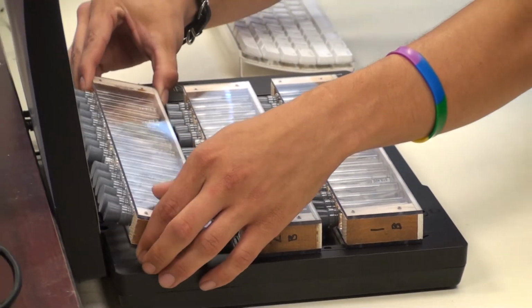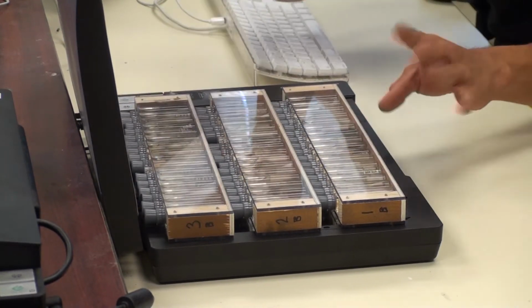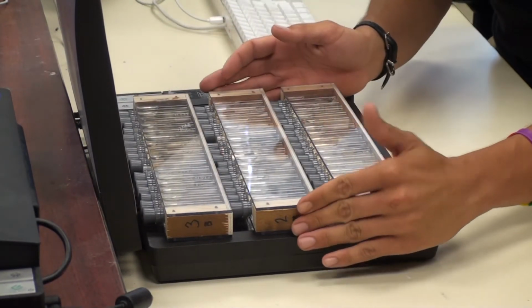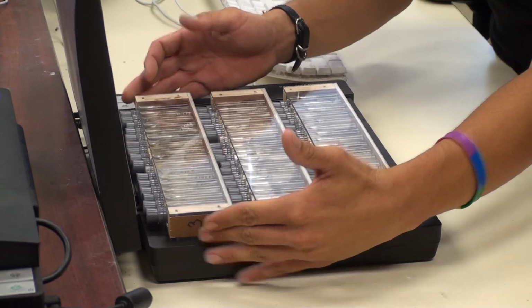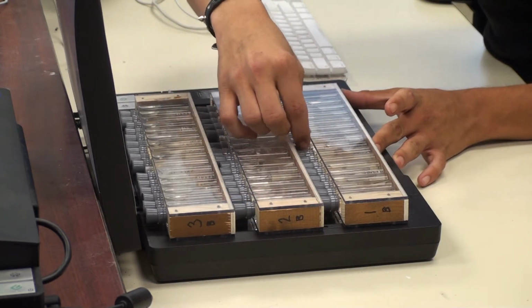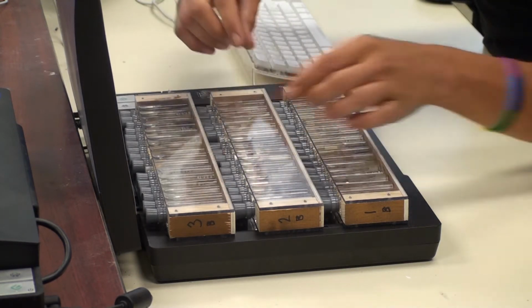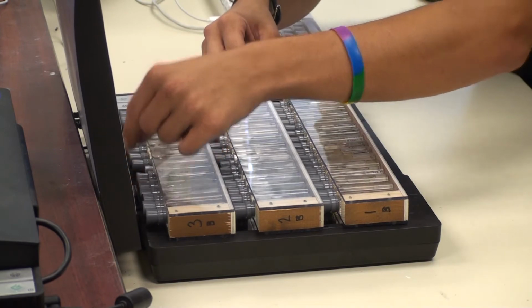And be very gentle as you place them onto the scanner. Sometimes these vials get a little jumpy and they go running all around, and you don't want that happening. I want to go through and just make sure everything is oriented the way I had intended. Sometimes they shift when you're flipping them onto the scanning bed, but for the most part it looks like we're good here.